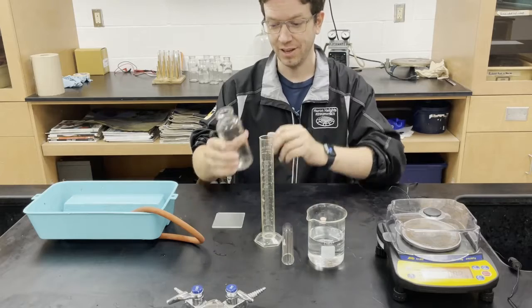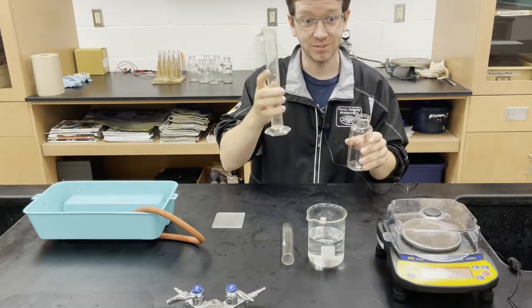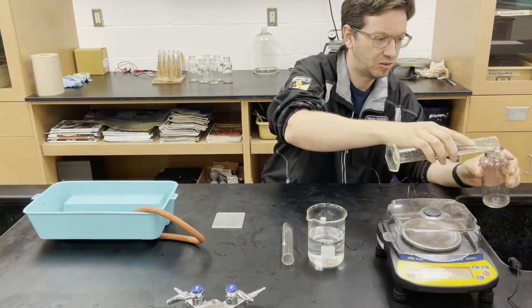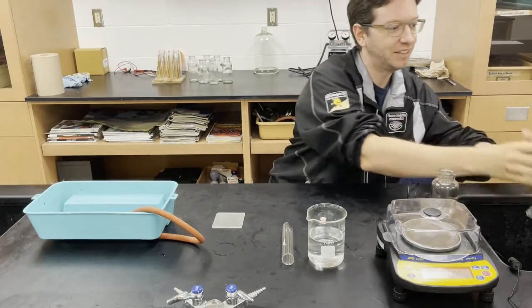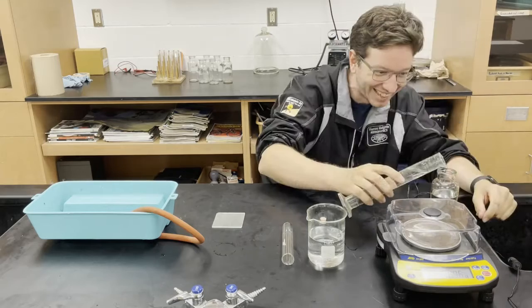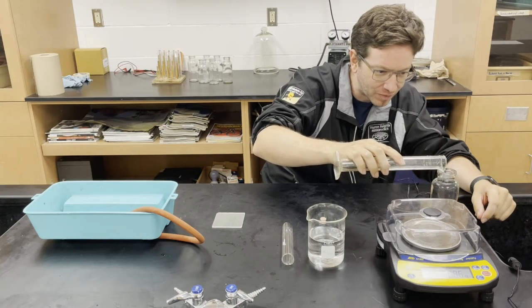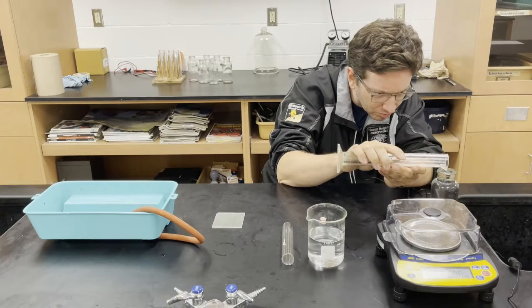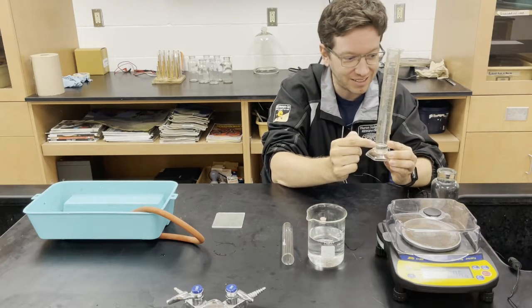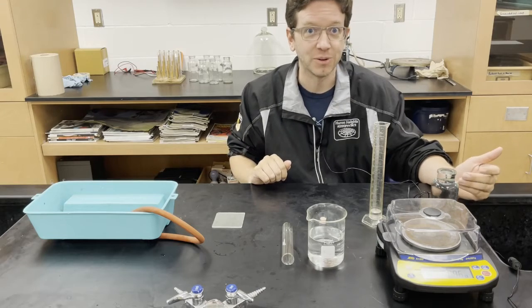Next, what we need to do is figure out the total volume inside of this gas cylinder. We are going to use graduated cylinders to keep adding water to figure out exactly how much water is required to fill this. There's 100 milliliters, then another 100 — so 200 milliliters — right up to the very brim. And we're left with 8 milliliters, so that means I added another 92 milliliters. So this gas bottle contains a total of 292 milliliters.